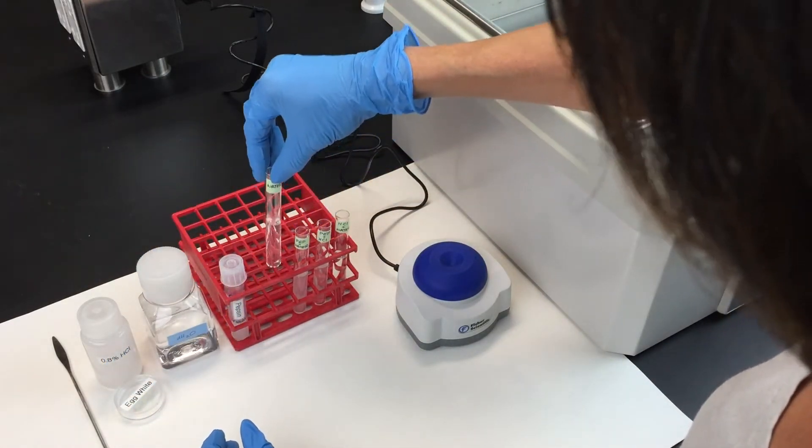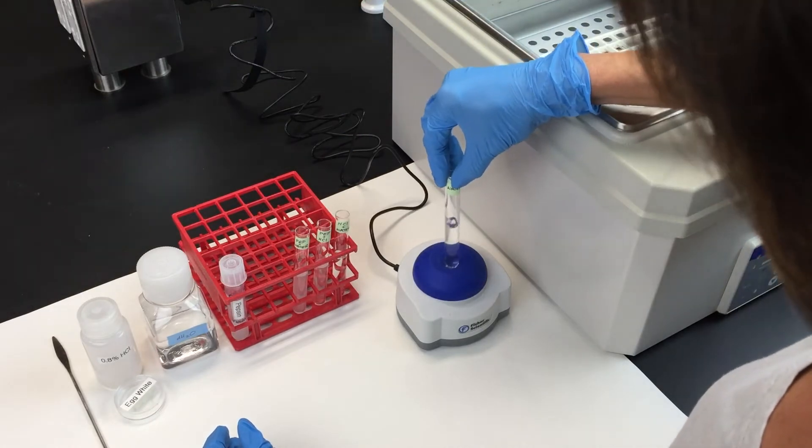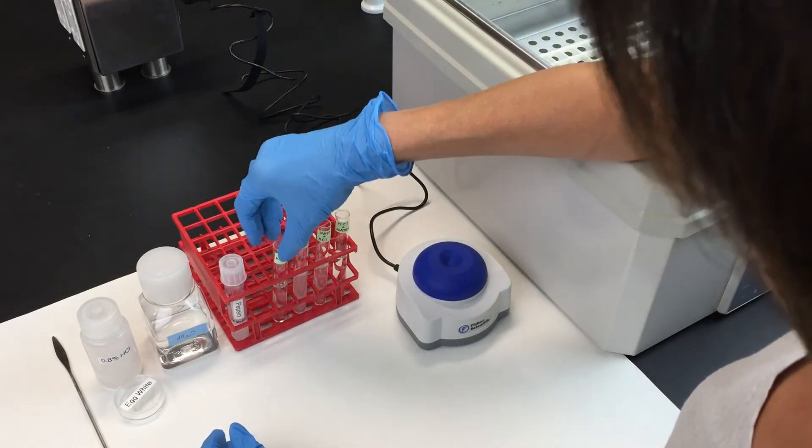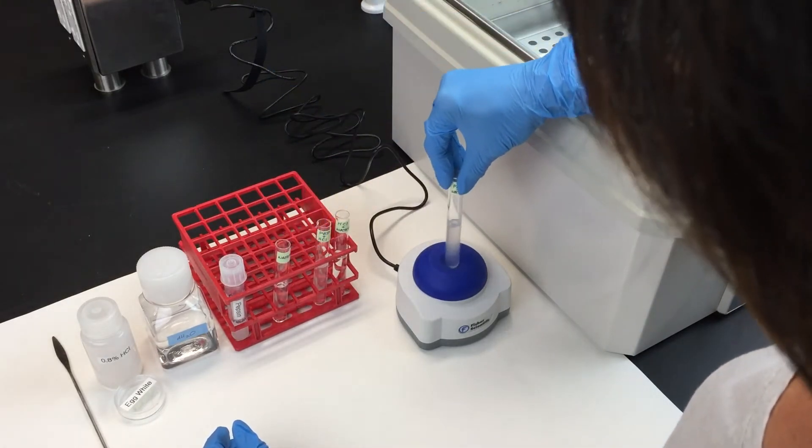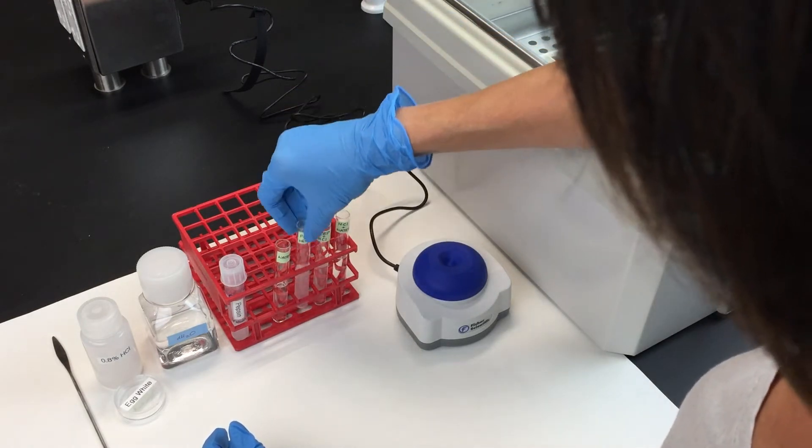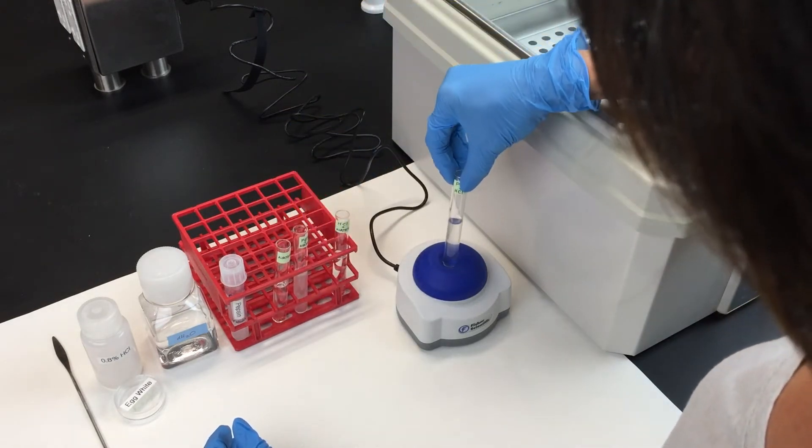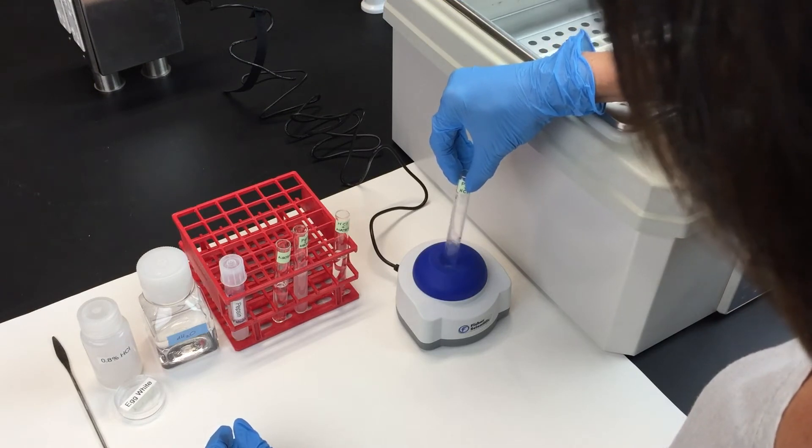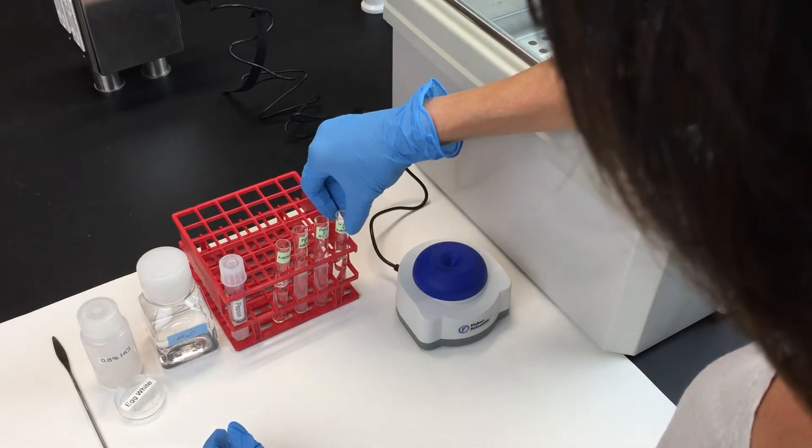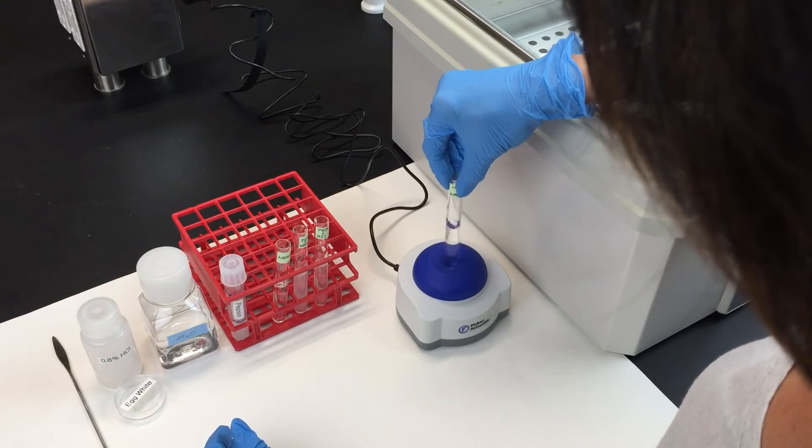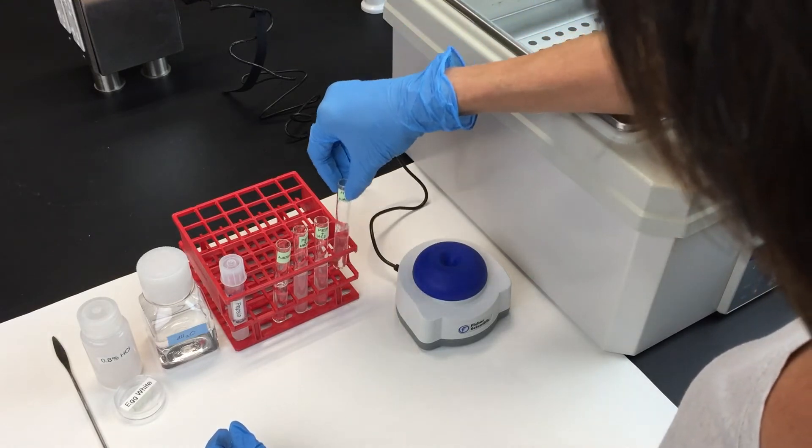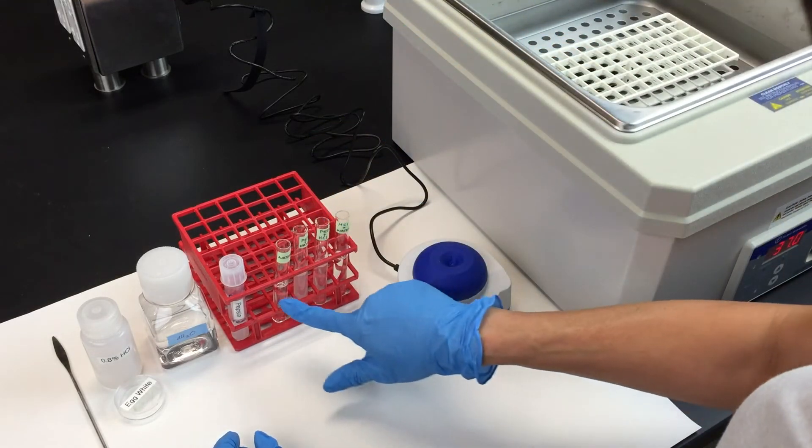Now mix each test tube well before adding your egg white. Your test tubes should be about half full and should contain the same volume of liquid.